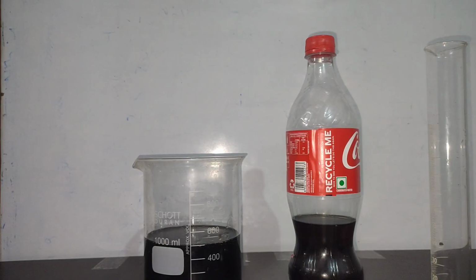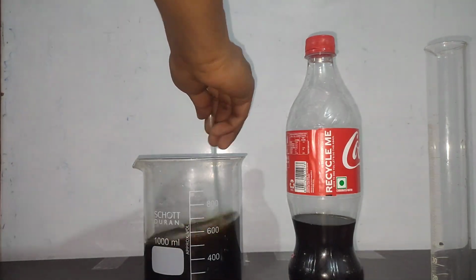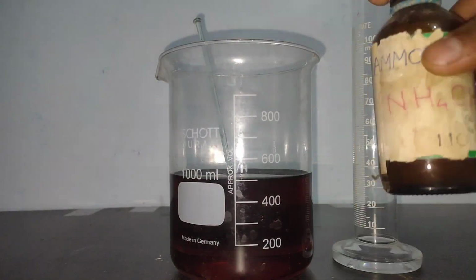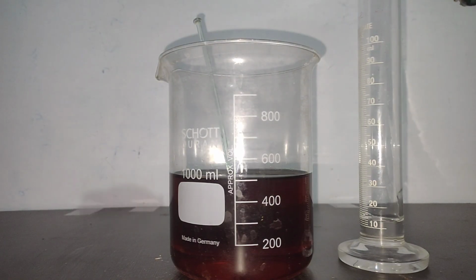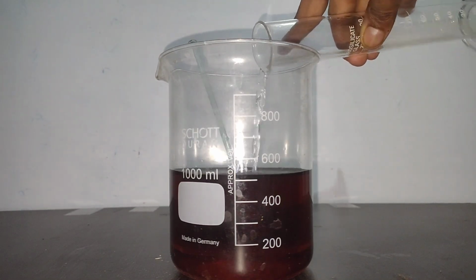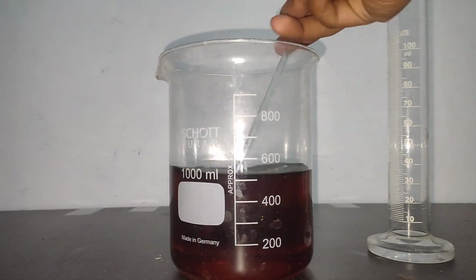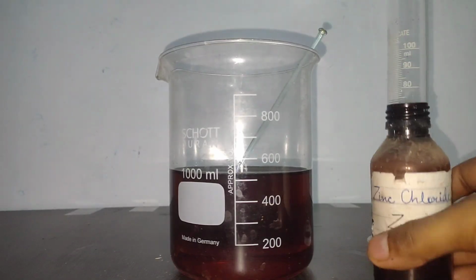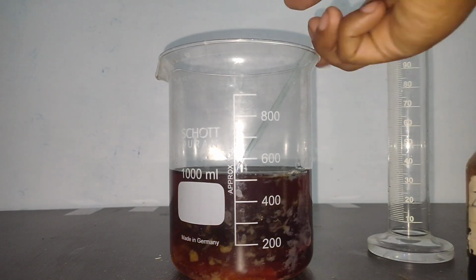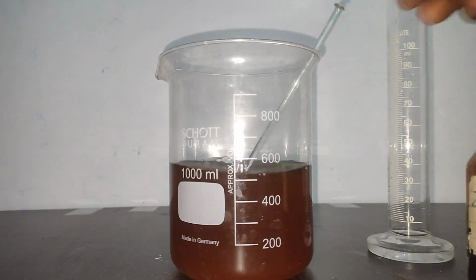Ammonium chloride is added to buffer the solution, and the method that I will use here is the gravimetric precipitation of zinc ammonium phosphate. So for that I'll be adding some ammonium hydroxide. First I added 20 ml of ammonium hydroxide. This is dilute ammonium hydroxide, and then to it I added zinc chloride solution.